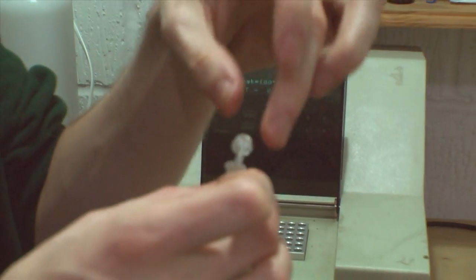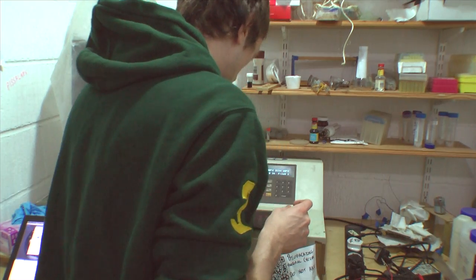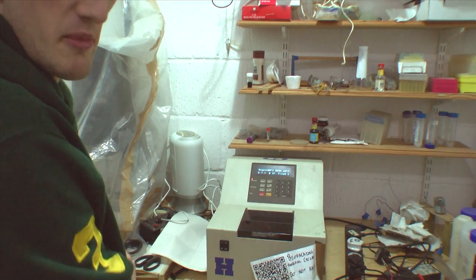Should we put it in? So if someone didn't have one of these, you can just put it in boiling water, which has exactly the same effect. Okay, so we do this for 10 minutes.